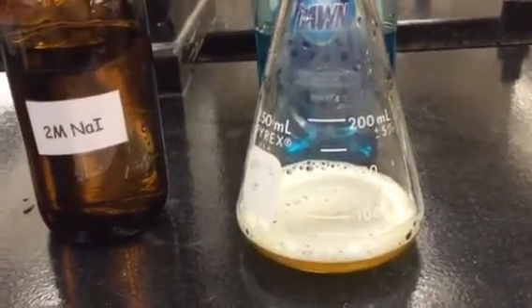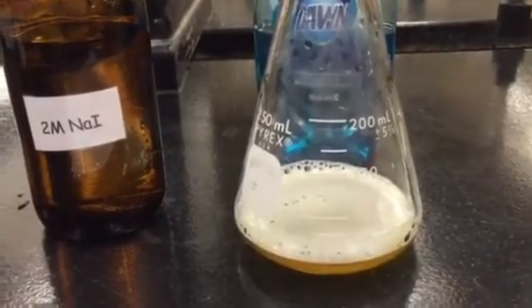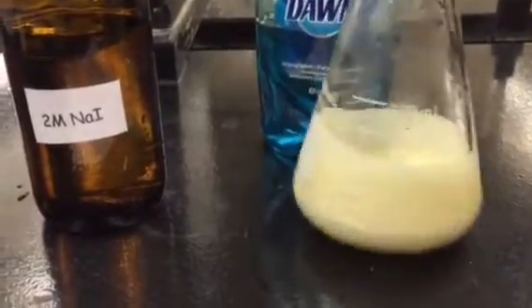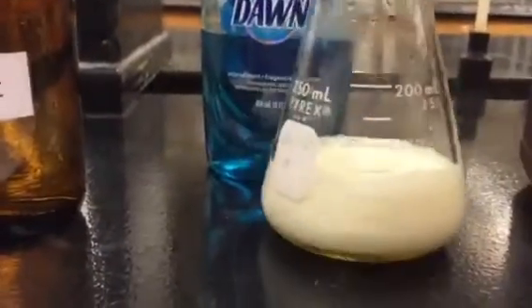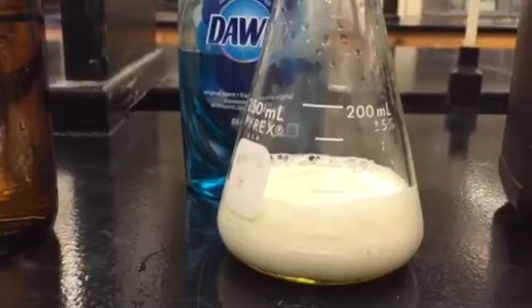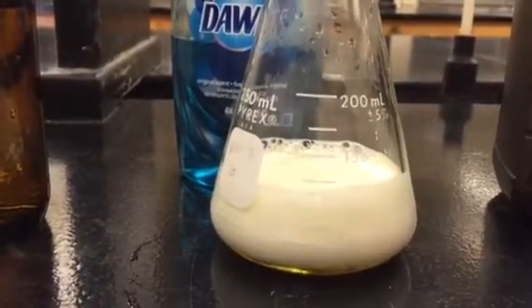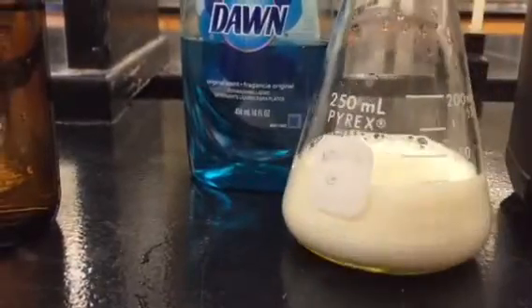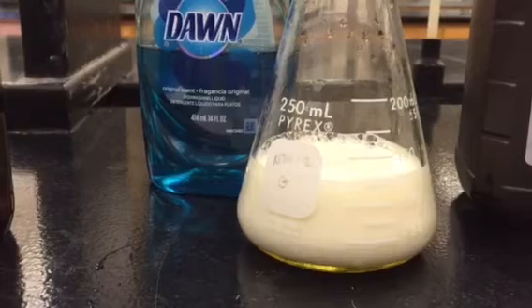Now, the catalyst is not part of the final reaction. Every 2 moles of hydrogen peroxide produces 1 mole of oxygen. That'll be important in the calculations at the end. Now, this part of the video is sped up to 2x using iMovie in the interest of time, but the whole experiment takes about a minute and a half to occur, which is practical in a lab setting.